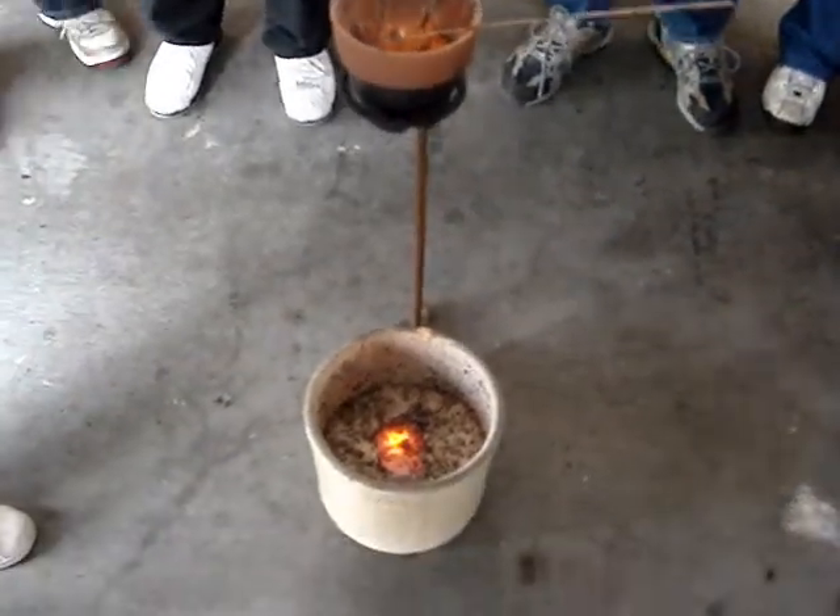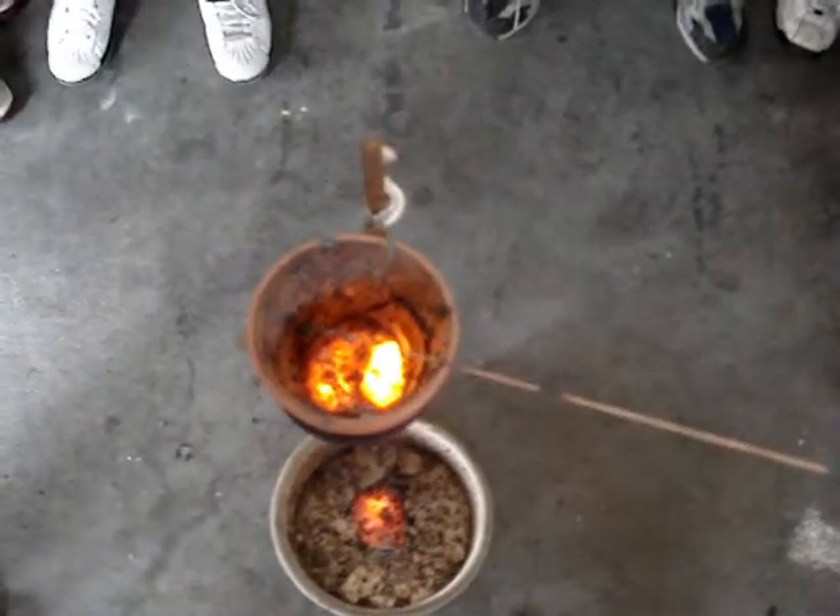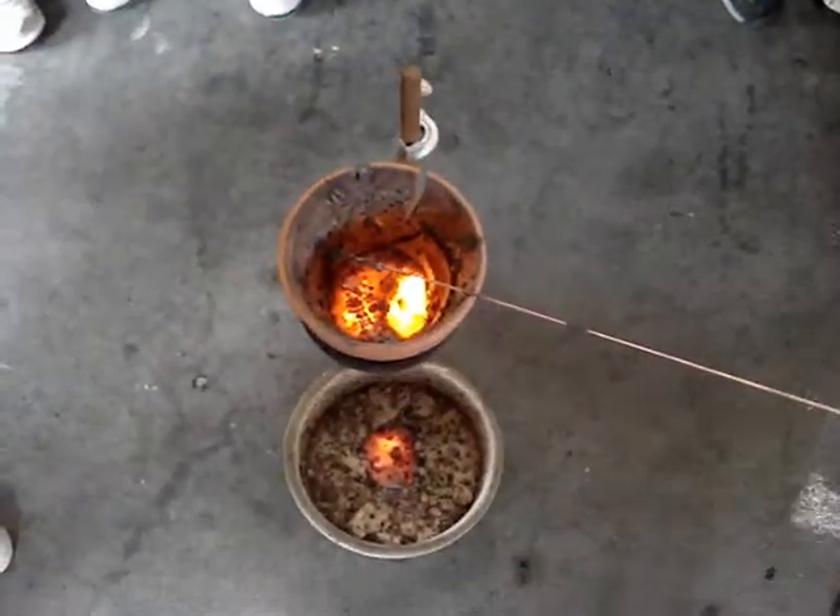What's going to happen is it's going to stop glowing — it already broke the thing. That stinky, sulfur-y smell is the gas you're going to smell.